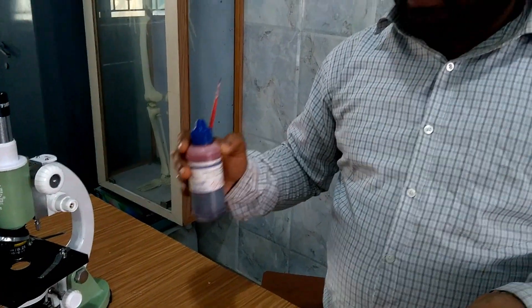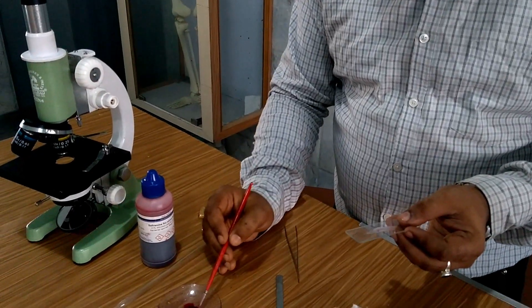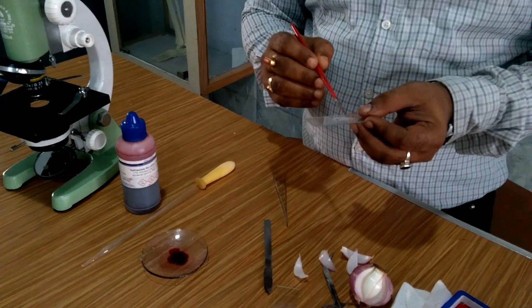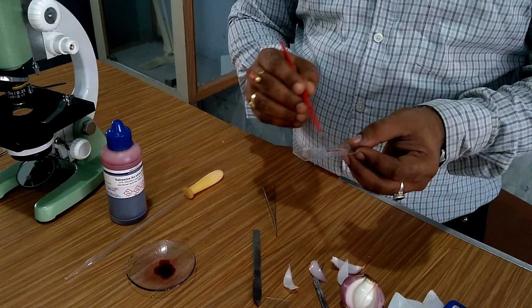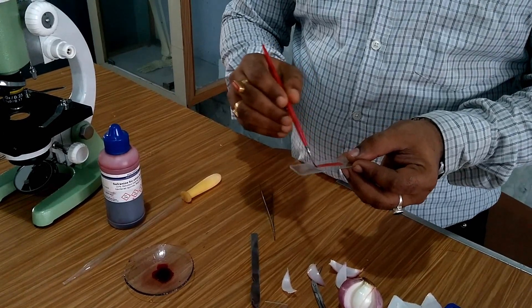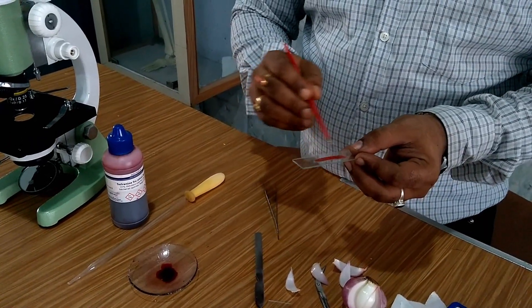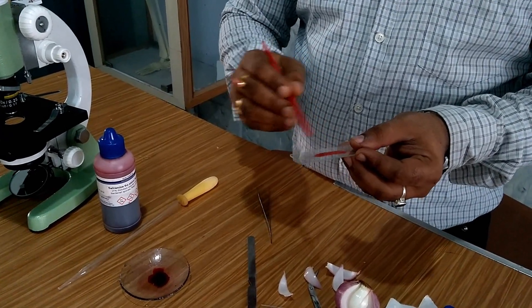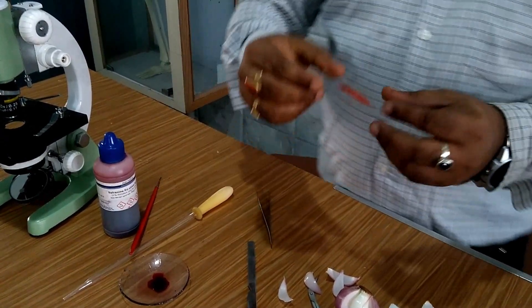I will use one brush over here. You only need to take a very little amount of safranin stain and just pour the safranin over the Allium cepa cells. So now your slide is ready for observation.